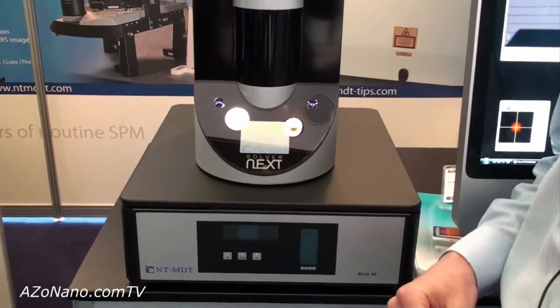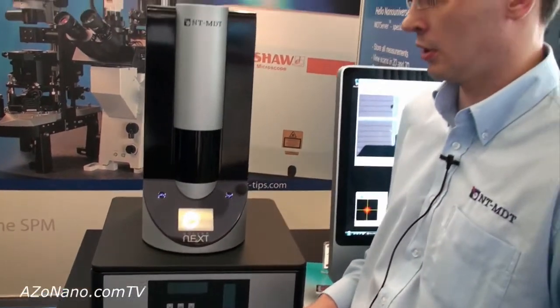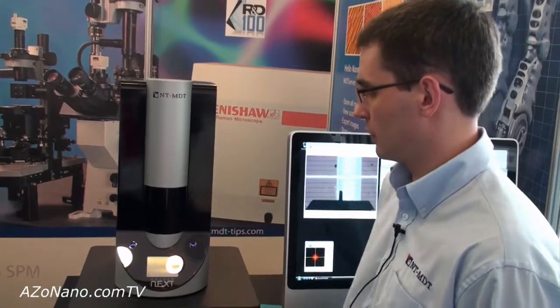This means it's easy to use and does not require special skills from the operator to run the instrument. I would like to show you briefly what's inside this system and how to operate it.